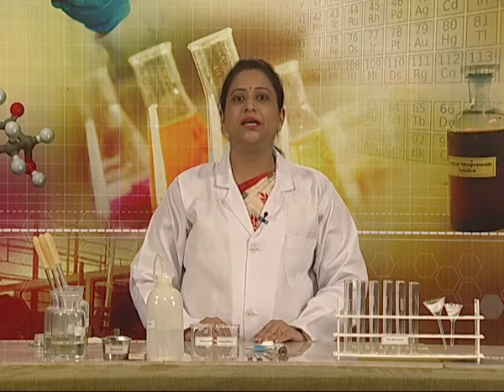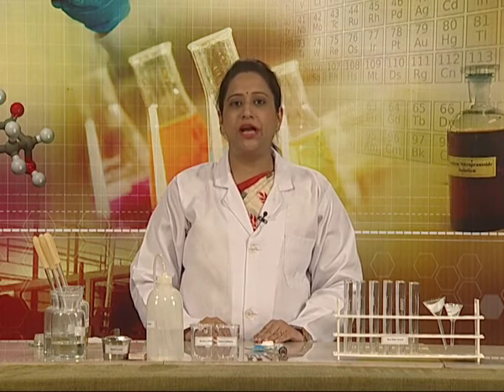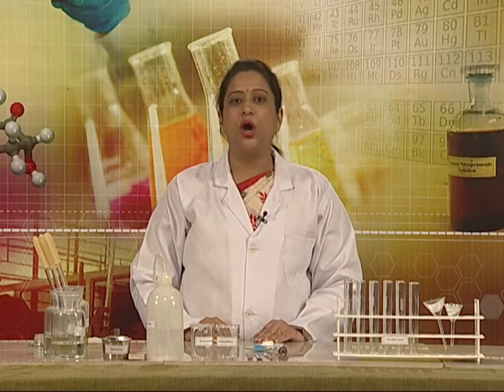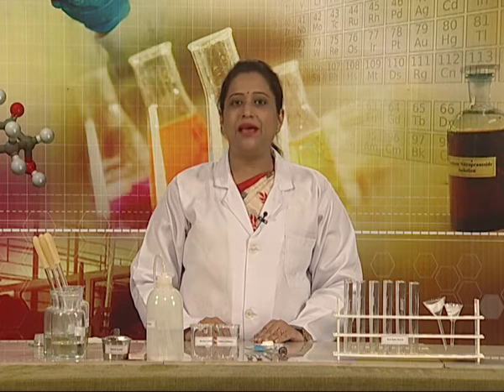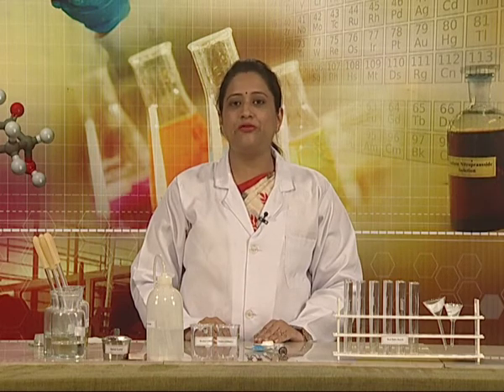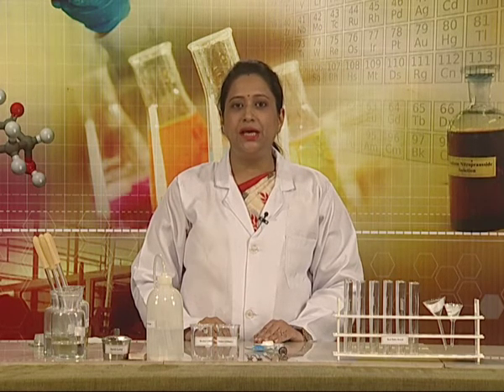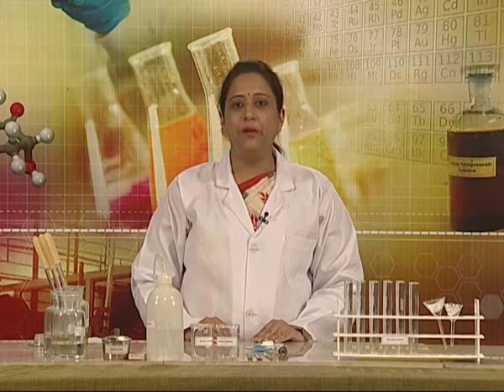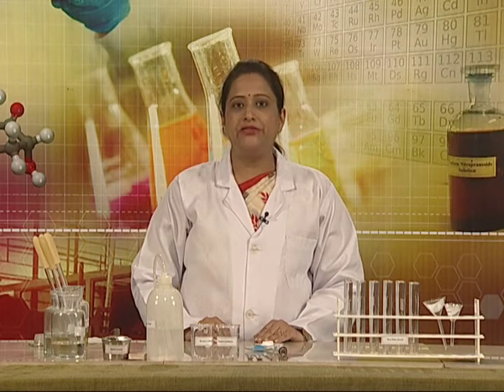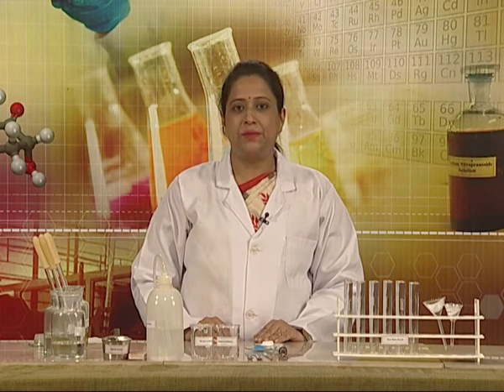Hello everyone. In the scheme of qualitative analysis of cations, copper ions and lead ions are the cations of group 2. Today we will perform the test for identification of these cations.